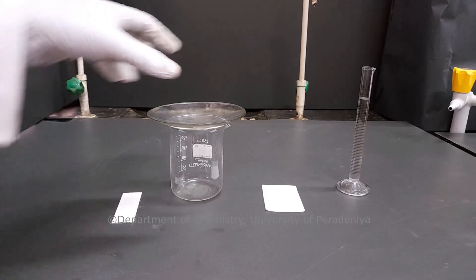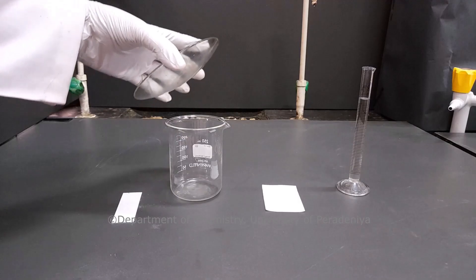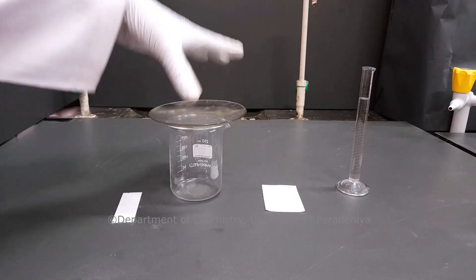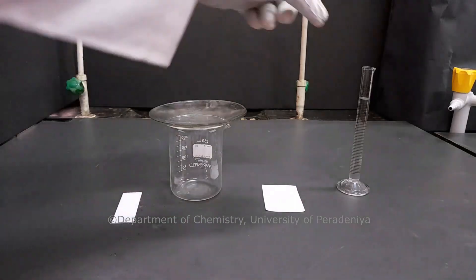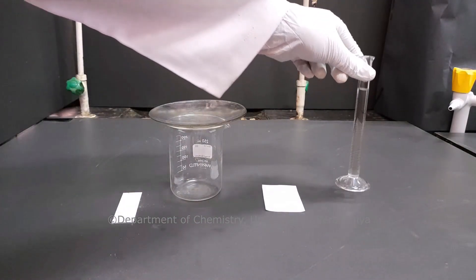A simple TLC chamber can be developed using a beaker and a watch glass. Also, we need a filter paper and a solvent as the mobile phase.